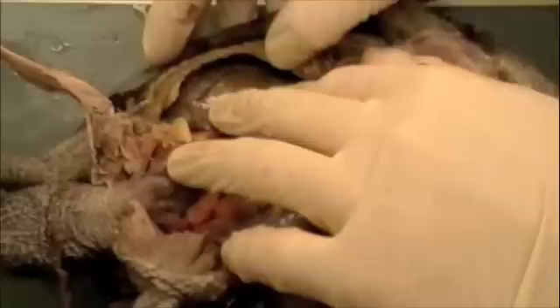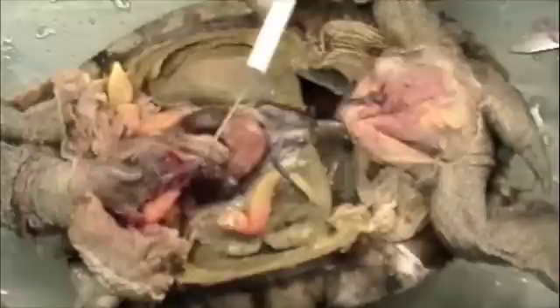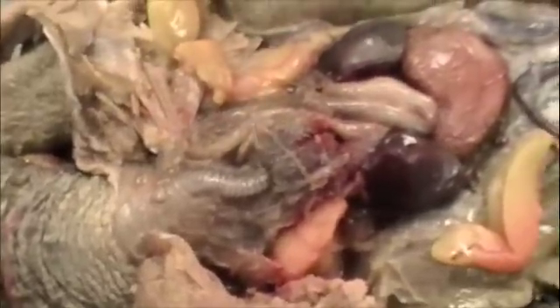If you can just follow that down. Look at those nice, pretty insides. All right, so what do we have going on here? There's the heart. That is crazy looking. I think it's definitely the liver. Can't really see under it without tearing it apart. So, do you remember where we said the lungs were? Liver here. This is the ventricle, and this is the left and right atrium. And these are most likely the pulmonic artery and vein. And then there's the trachea.